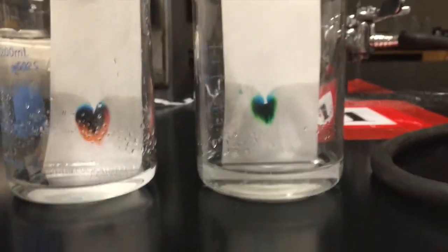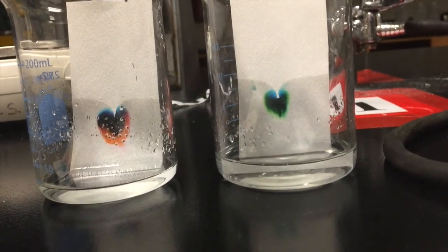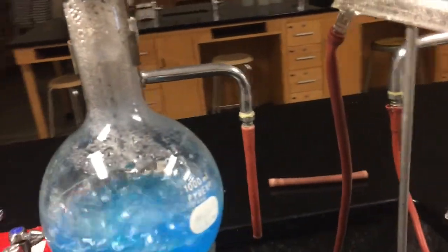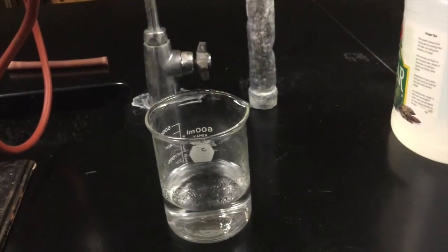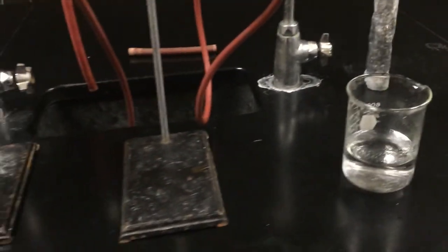Here is what the black will look like over time. You can see it looks like the black pigment has blue and red and yellow and a couple of other colors in there. And the green shouldn't be too surprising to you. Looks like the green has some blue and yellow pigments in there that move to different rates. And that's what I'll see as this continues and the water continues to move up that filter paper. So this is called chromatography. And this, separation due to differences in boiling points, is called distillation. All righty. Thanks. Bye-bye.